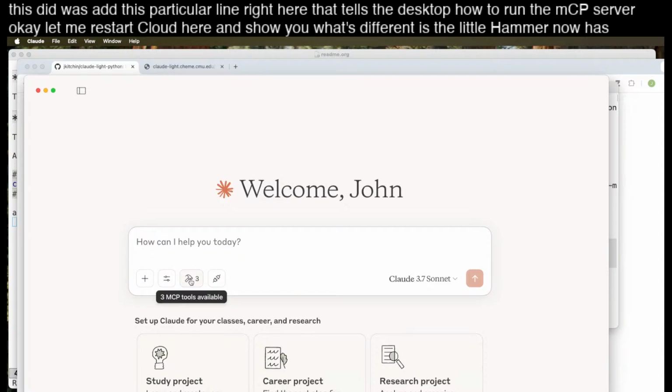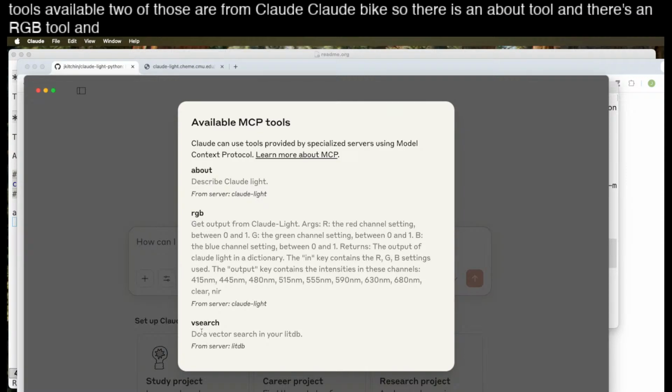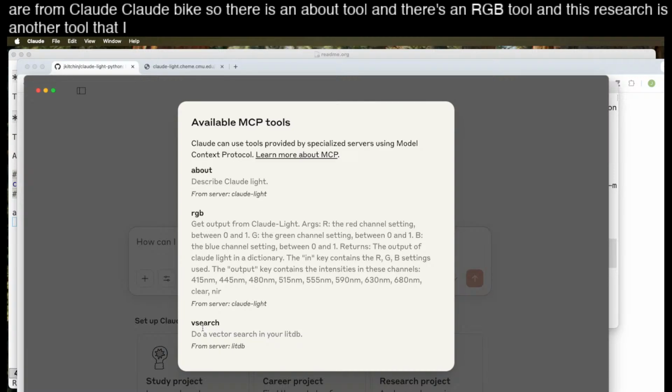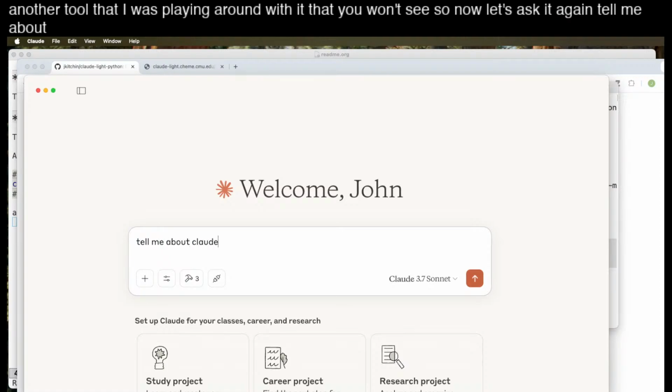and show you what's different. The little hammer now has 3 MCP tools available. 2 of those are from Claude-Light. So there's an About tool and there's an RGB tool, and this vSearch is another tool that I was playing around with that you won't see. So now let's ask it again. Tell me about Claude-Light.